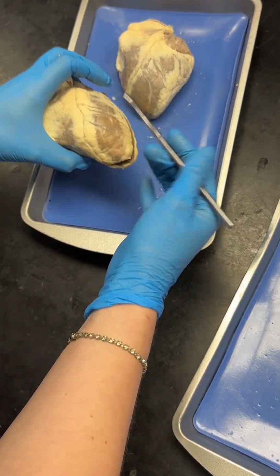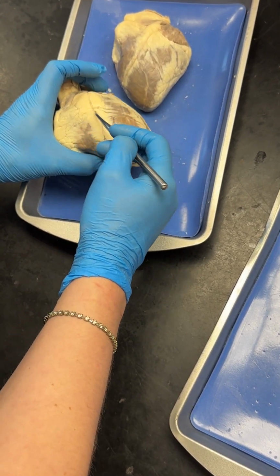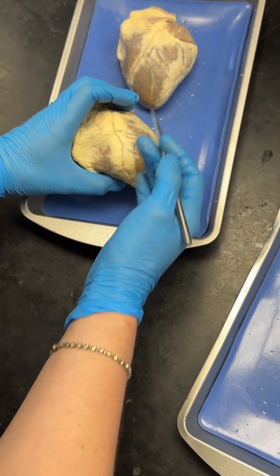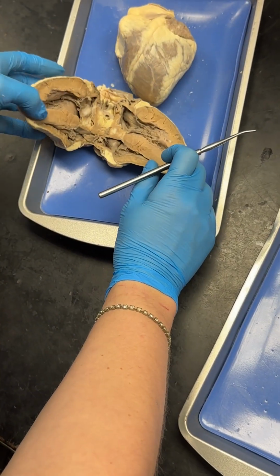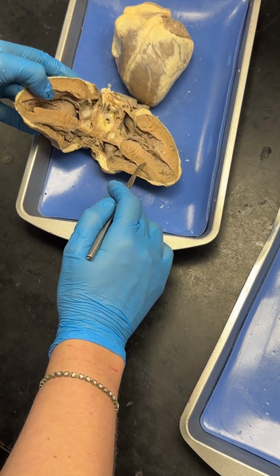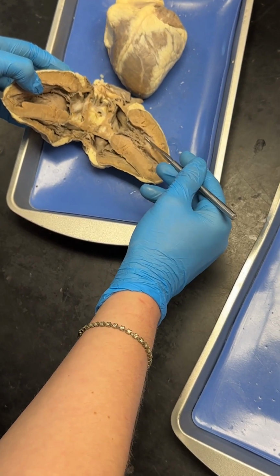All right. There's also, and again, condition of the heart really depends if you can see this or not, but these are going to be your interventricular grooves here. So this is basically on the outside where that interventricular septum is going to lie. On the inside, here we've got our interventricular septum. It is, as the name implies, the septum or the divider between the two ventricles.